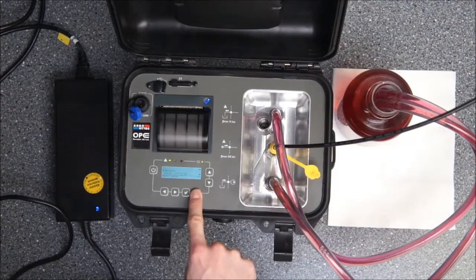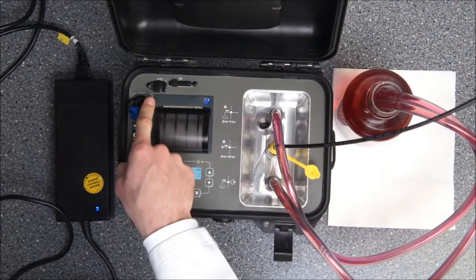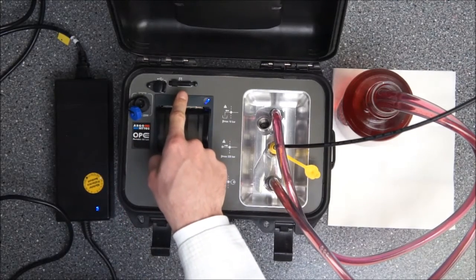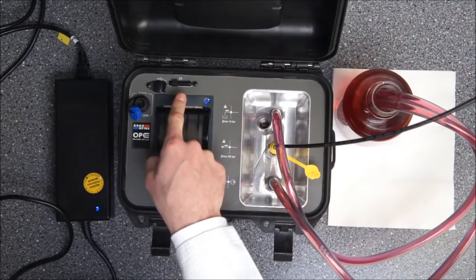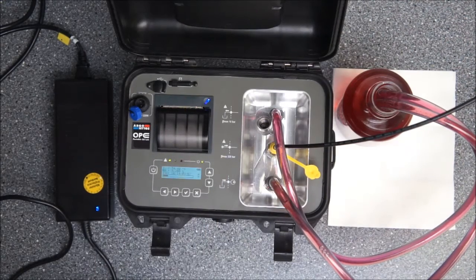The internal memory can be printed out as shown before, but you can also read it out via the USB port or the SD card. Save the internal data on the hard drive and afterwards analyze it with any personal computer or program you like.